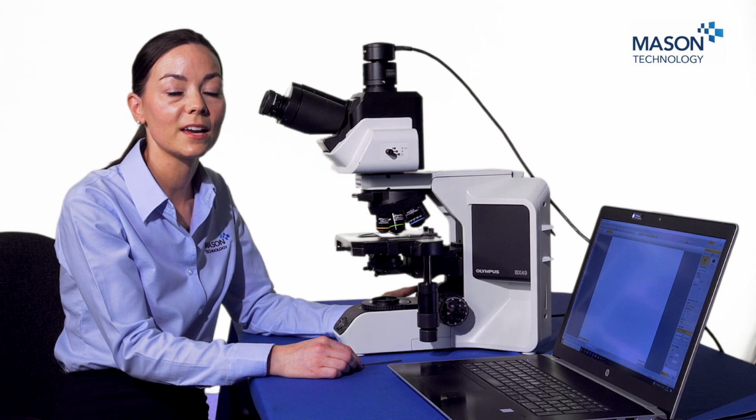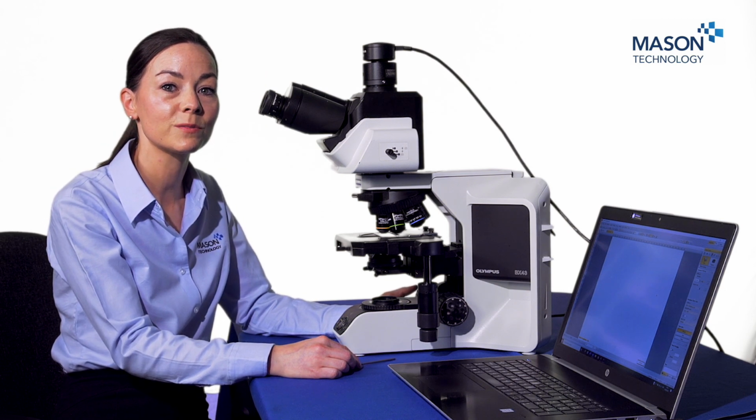So that's Köhler Illumination, and you can see more about numerical aperture in our objectives video on our website.